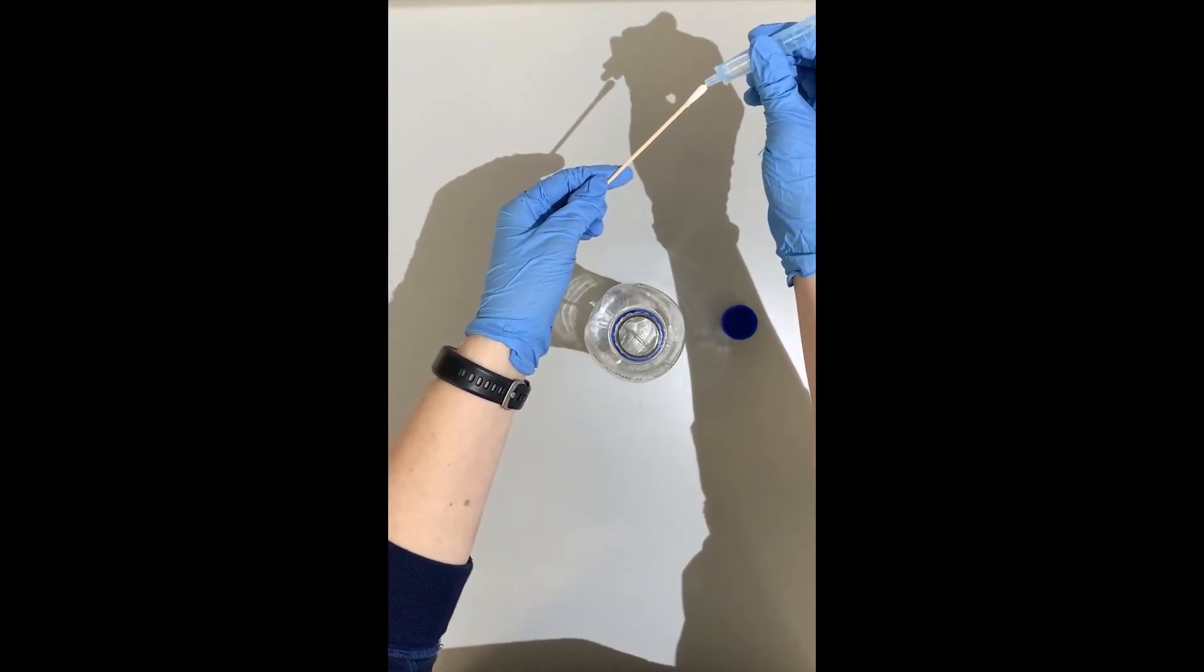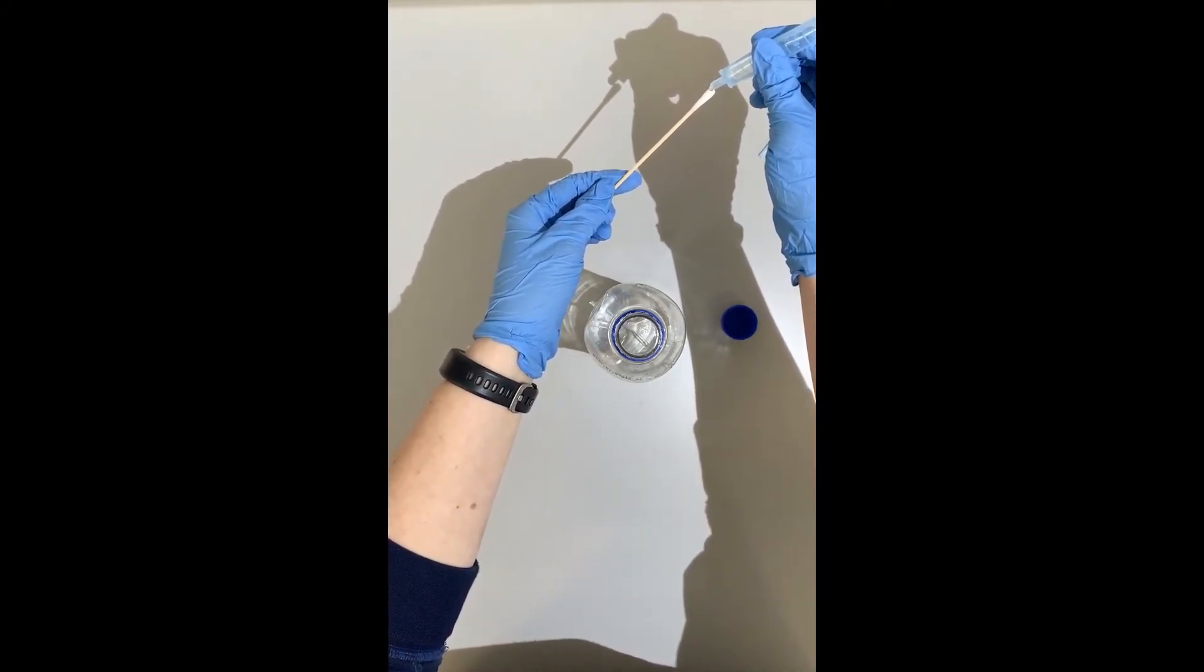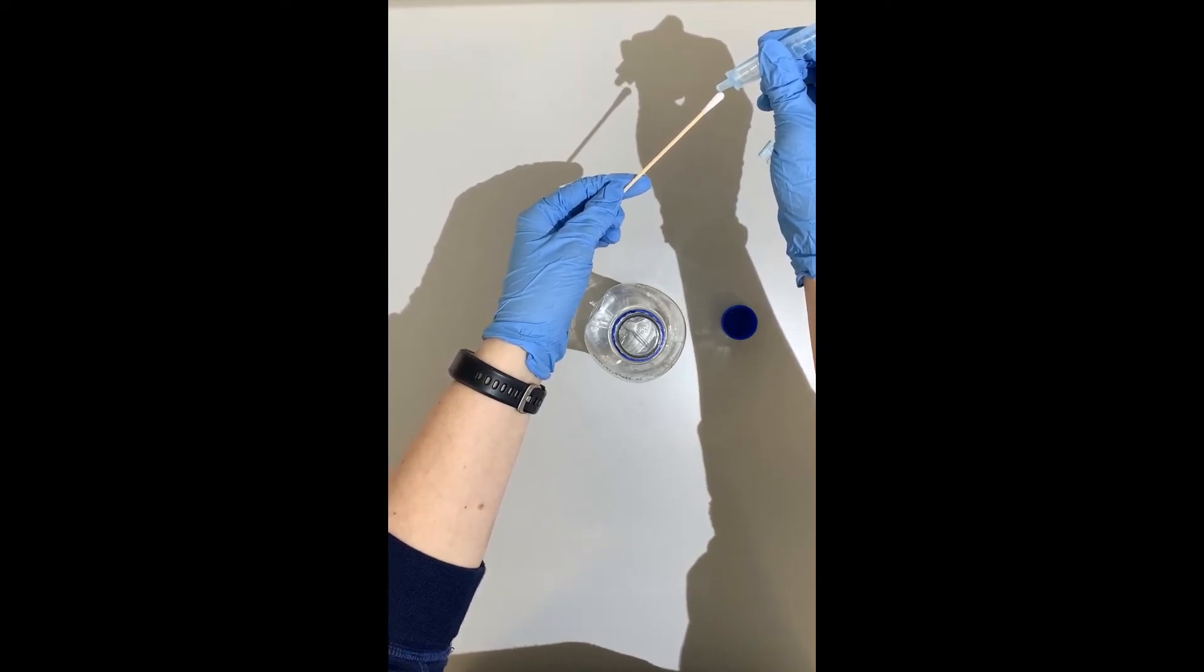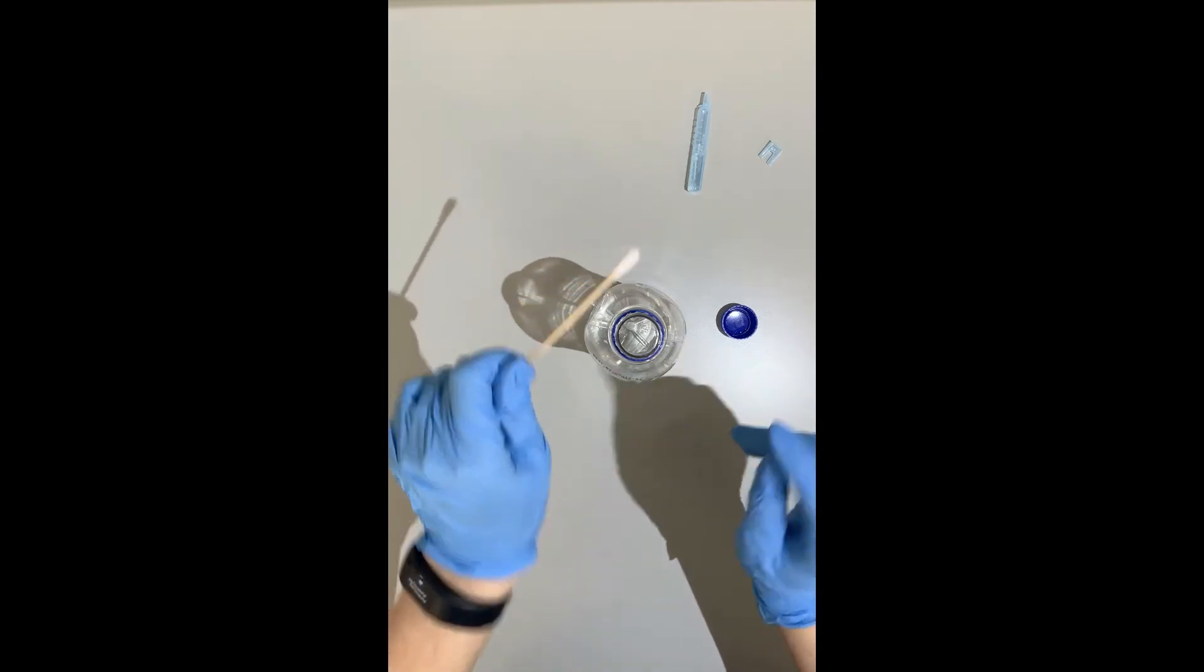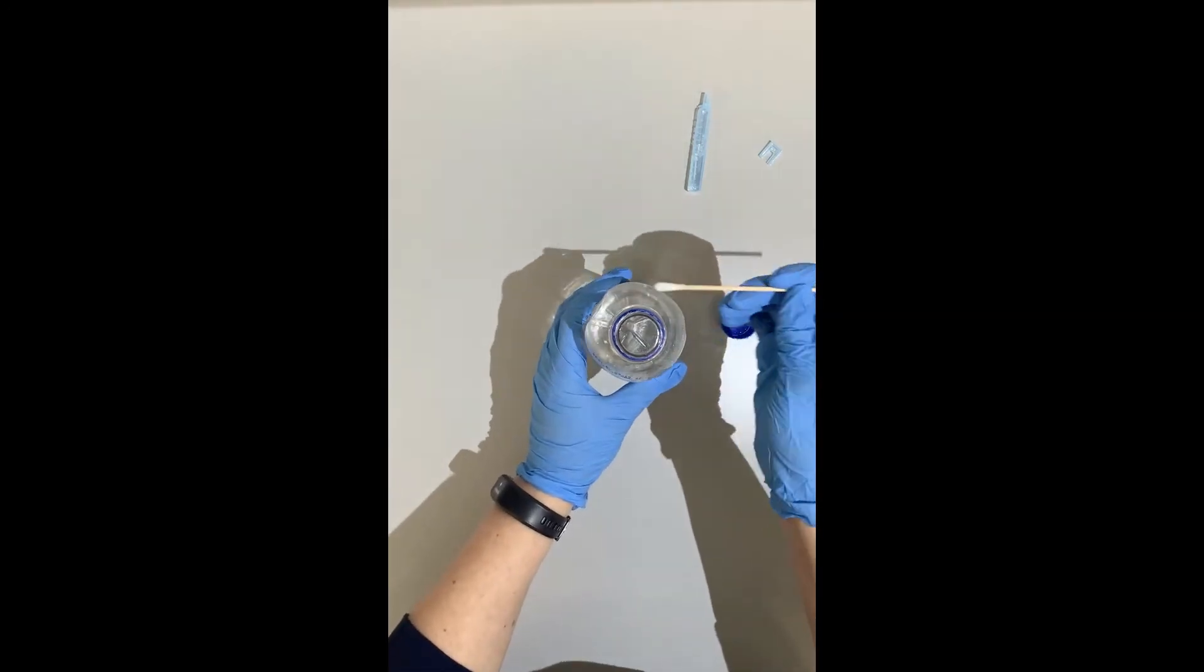I want to use just one or two drops of water just to moisten it. This is especially effective if you have like soda cans or Gatorade where they can get sticky in there.